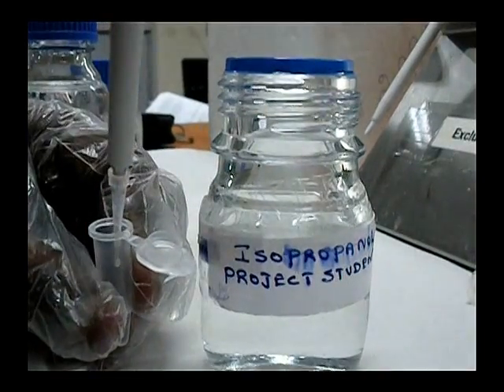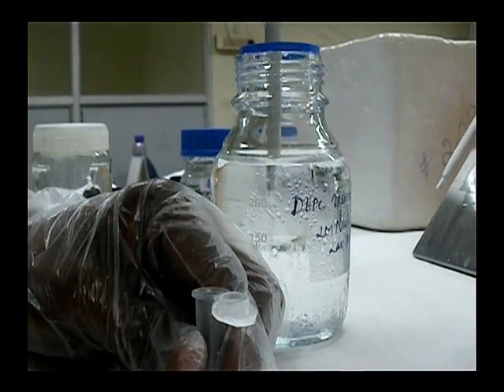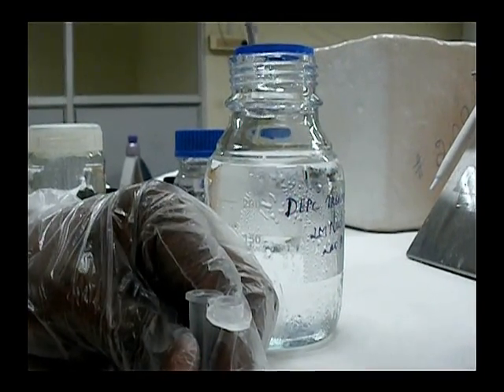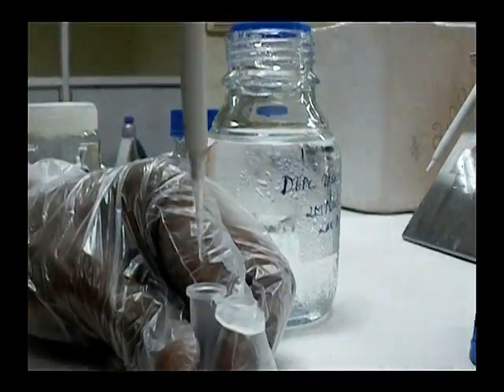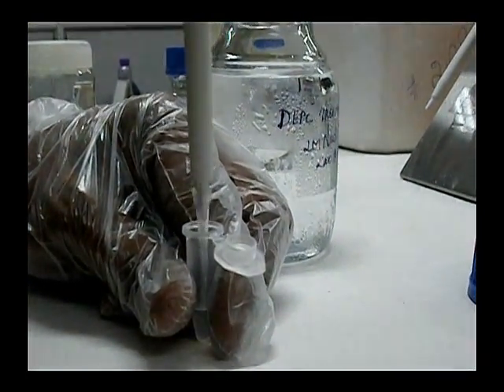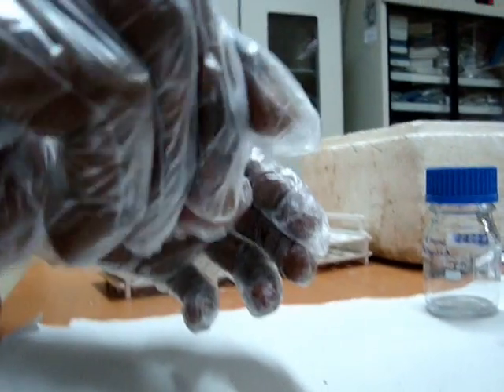0.2 ml isopropanol and 0.25 ml of 2 molar NaCl is added to aid in precipitation of RNA, to collect it as a pellet.